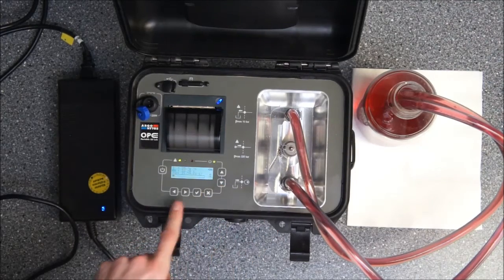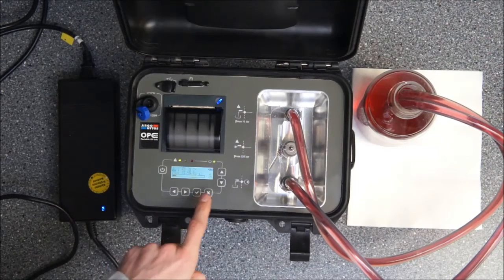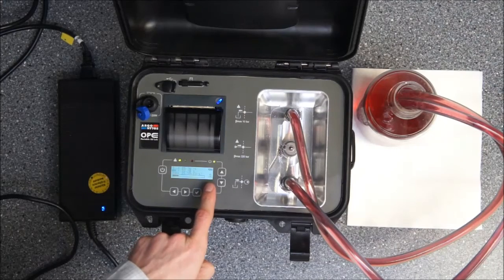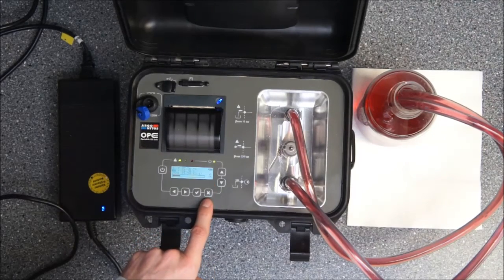Once again you see the measurement is starting and it will be done repetitively. You see that also by the indication of that A which stands for automatic mode instead of the manual mode that we had before.